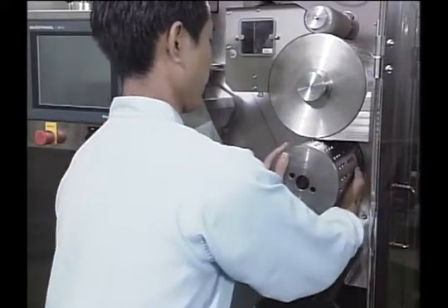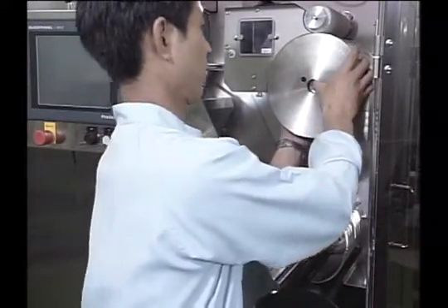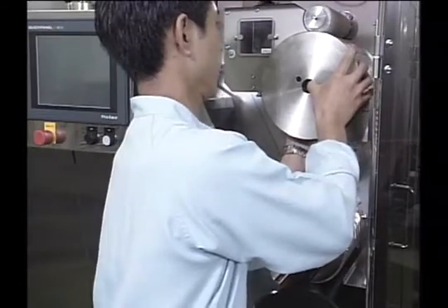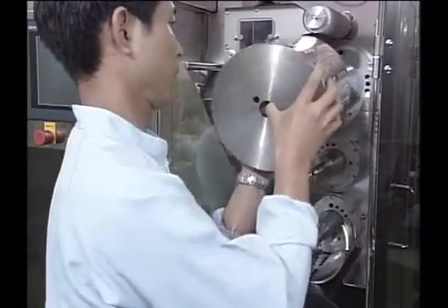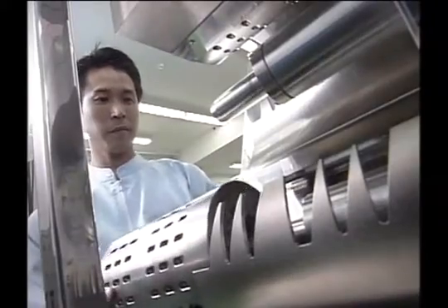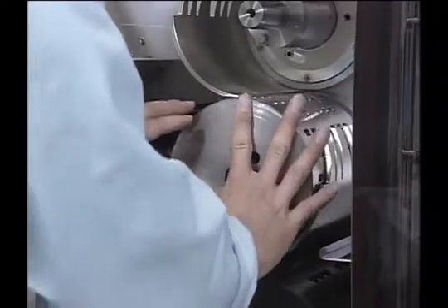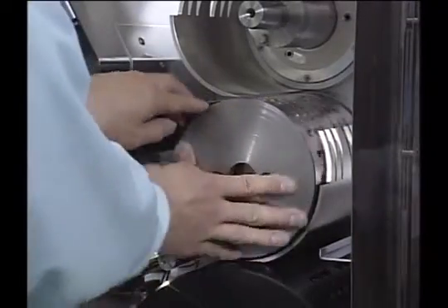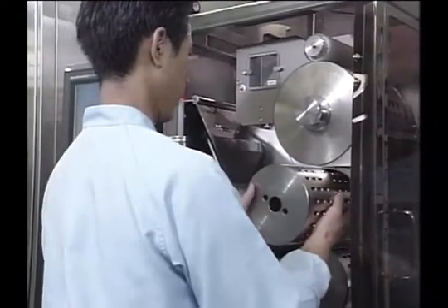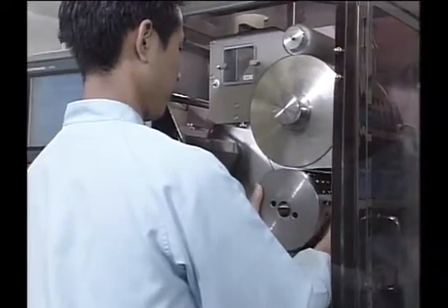The unit that controls the rectification or transportation can be detached without doing anything to the light or camera that have the main role in the inspection. It is also superior for cleaning validation, and the assembly status can be determined by just pressing one button. We can say that this machine was also developed by considering its versatility and wide range of uses.